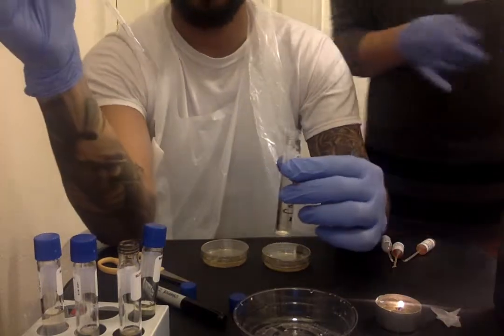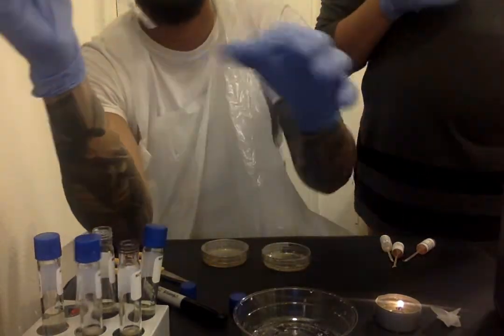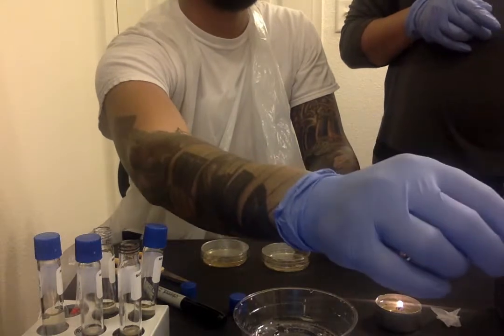Place the pipette into the bleach here. You want me to spray this out? Yeah.